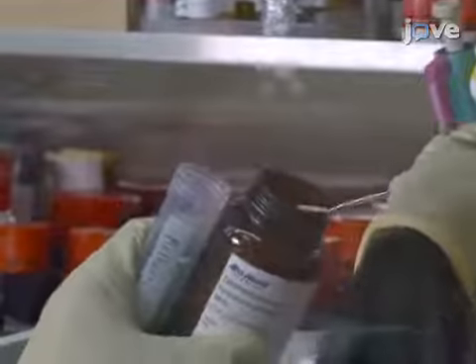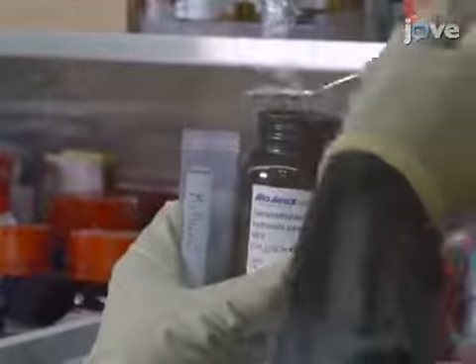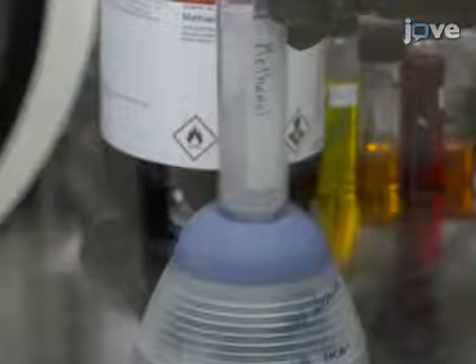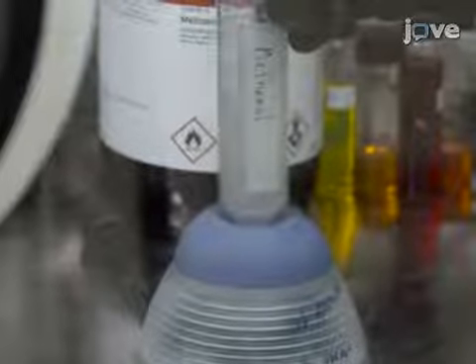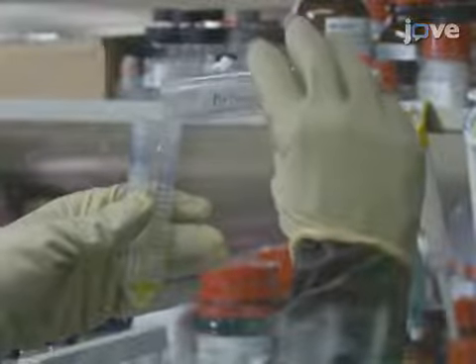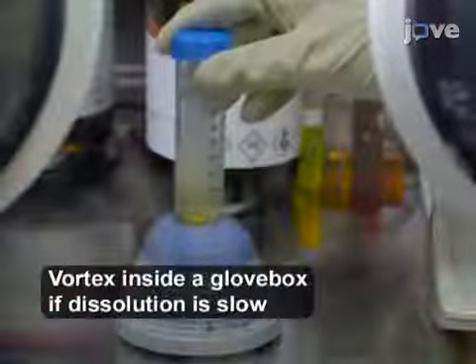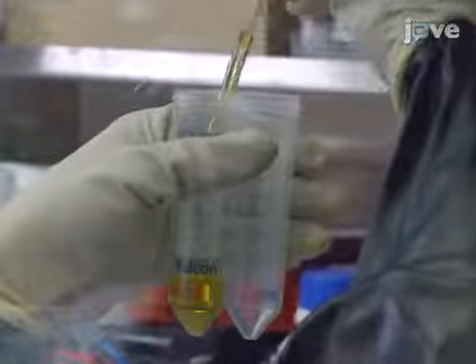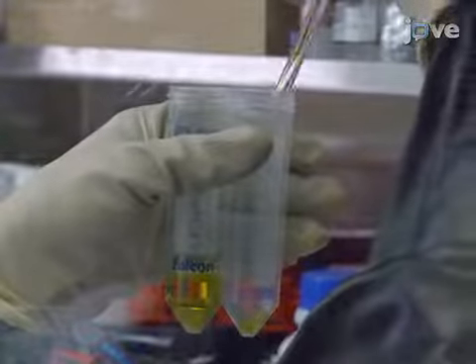Next, add 250 mg of mercaptoundecanoic acid and 400 mg of tetramethylammonium hydroxide to 10 ml of methanol in a centrifuge tube. Vortex until all the solids are dissolved. Add the methanol mixture to the cadmium sulfide cadmium selenide seeded rod pellet and shake the tube by hand to fully dissolve it. Allow the solution to sit for at least 1 hour. After 1 hour, split the solution into 2 centrifuge tubes.